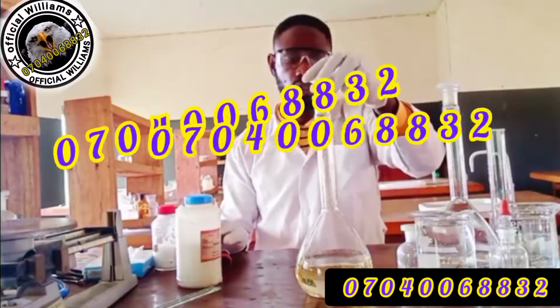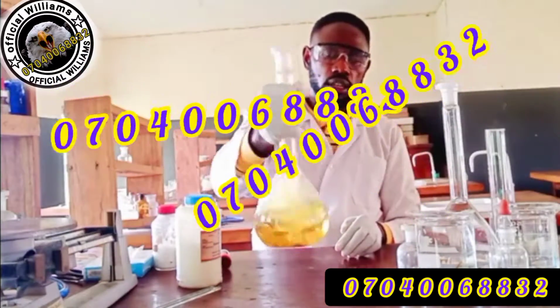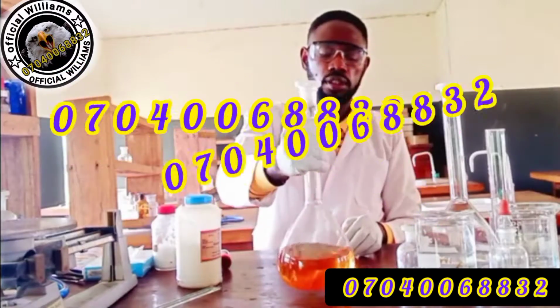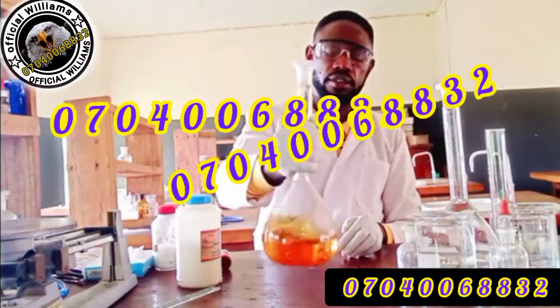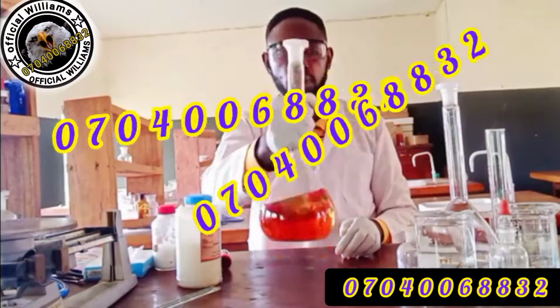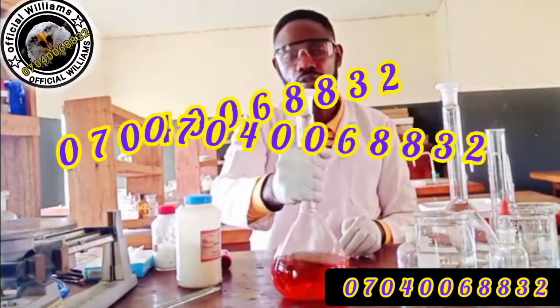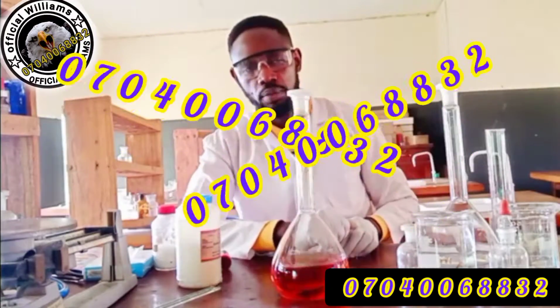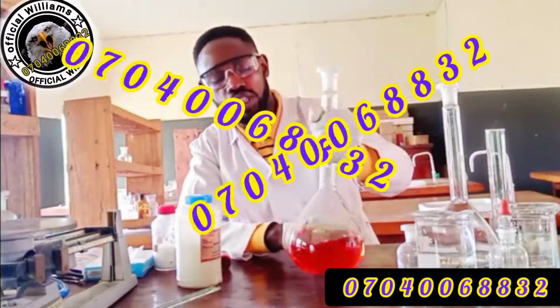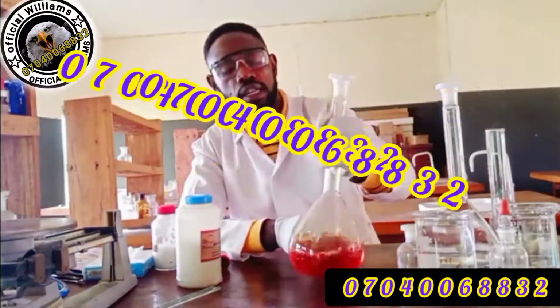So your job is now to close and shake. The dissolving will be gradual, and like I told you, from real analysis, there is no way 6 grams of potassium iodide will dissolve completely 25.4 grams of iodine crystal. From my own experiment, about 18 grams to 25 grams of potassium iodide will dissolve this completely.